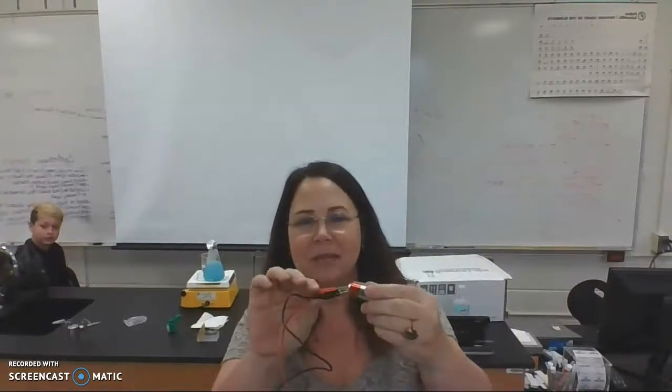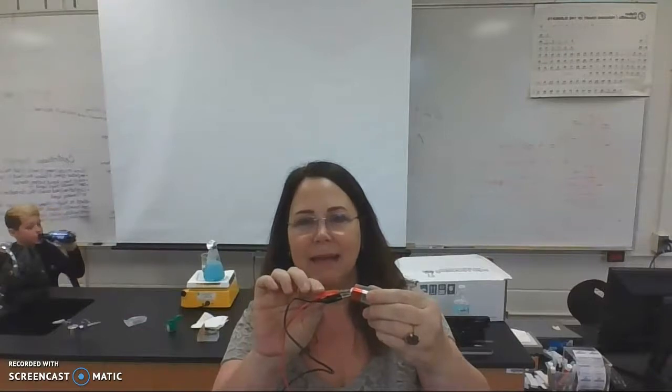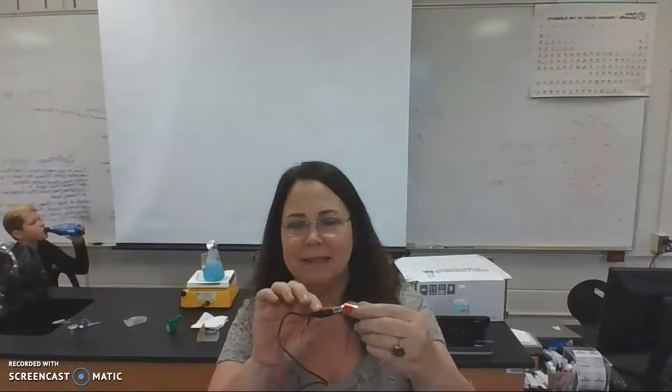This is your battery, and make sure that you clip the red alligator clip to the positive end, and then the black to the negative end.